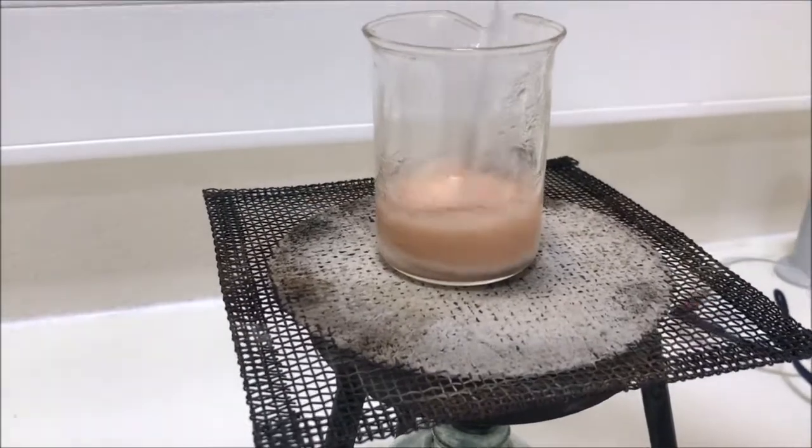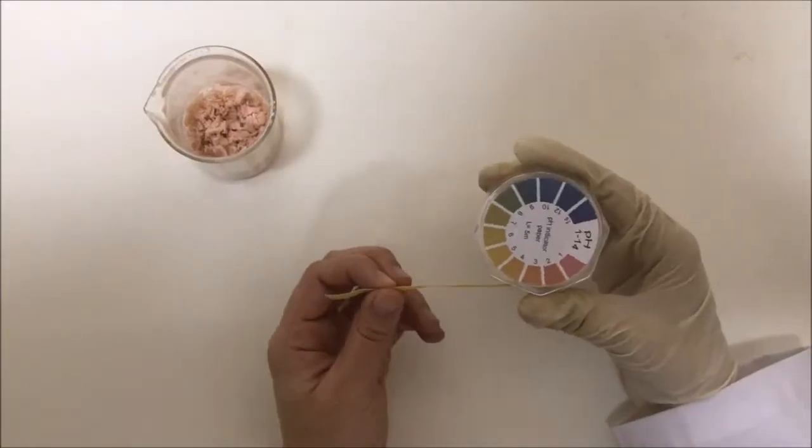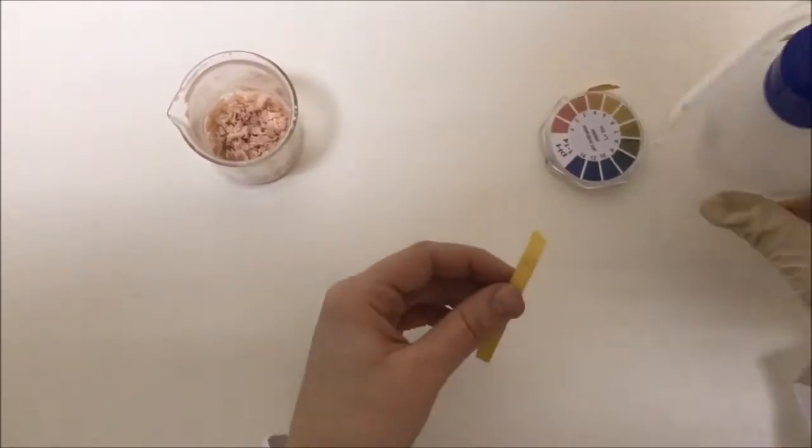Carefully remove the beaker from the heat and let it cool down. Test the pH of the initial soap using pH paper.